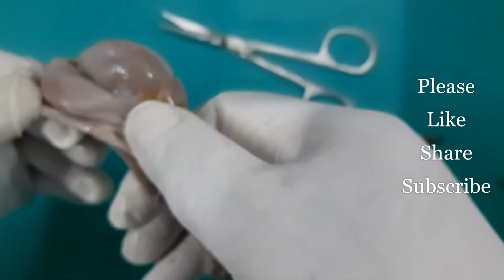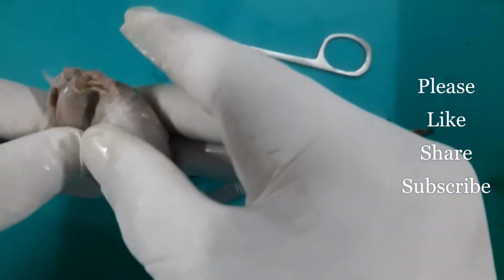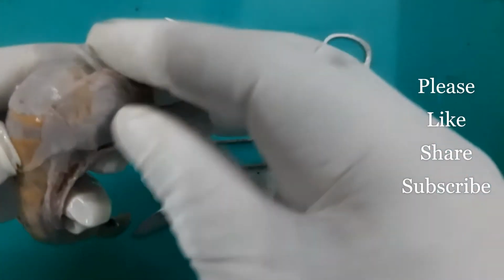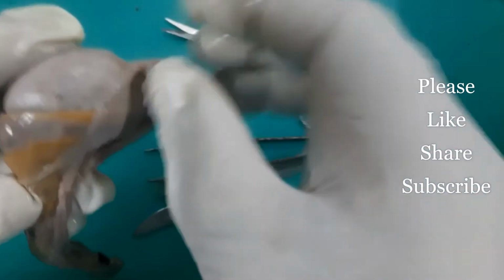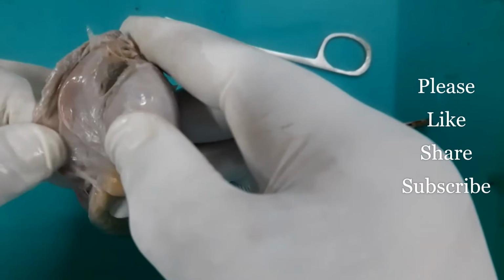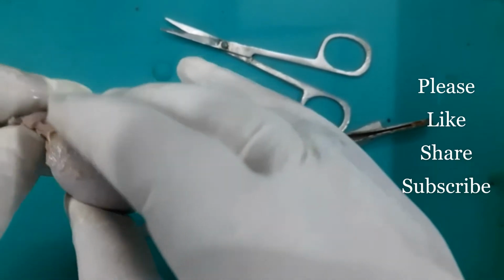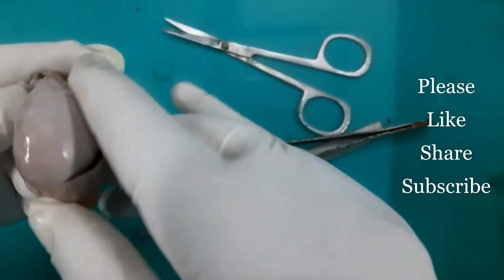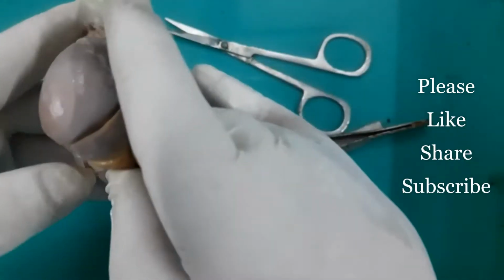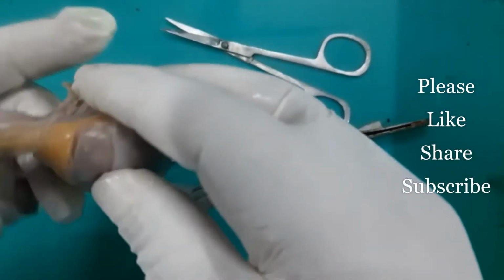See, here are the testes and epididymis exposed. Okay, so this is the testes and epididymis here. And after breaking the adhesions, I have exposed the maximum part of the testes: the left surface, the right surface, the lateral surface, the medial surface, then the anterior border. Okay, so this is the medial surface, this is the lateral surface, this is the anterior border of the testis, and this is the epididymis.